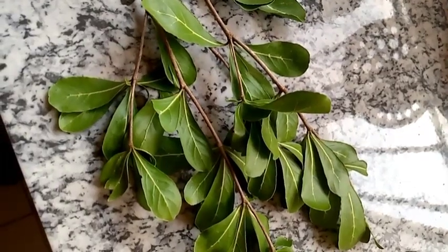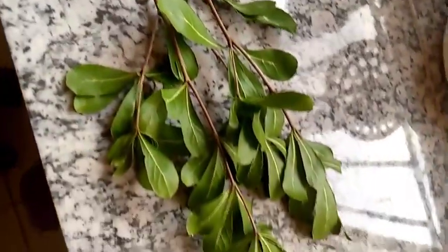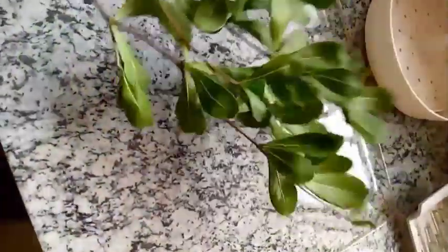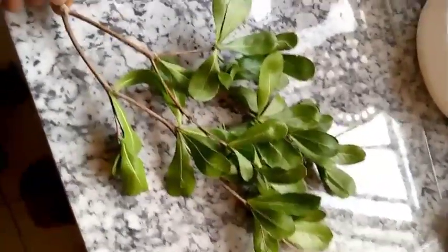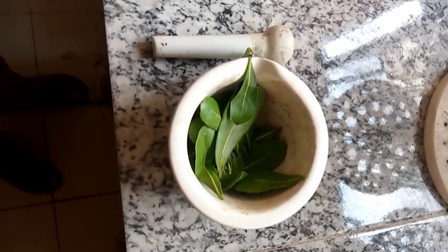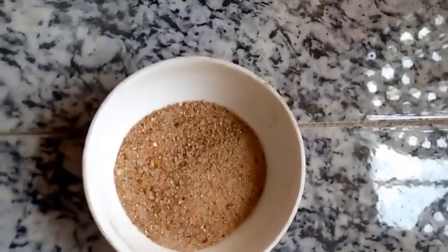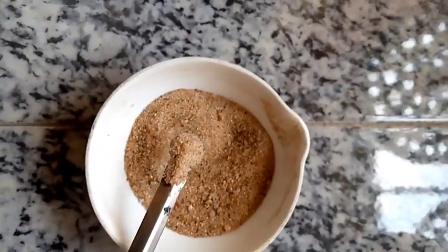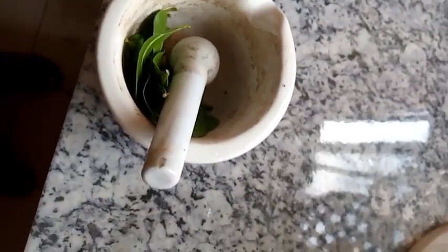We can go into the practical demonstration. This is a leaf for the extraction of the plant pigments. Now we will need mortar and pestle. We can cut the leaves into smaller pieces. We might need sand, like 2-3 spatulas, to ease the pounding for easy extraction.